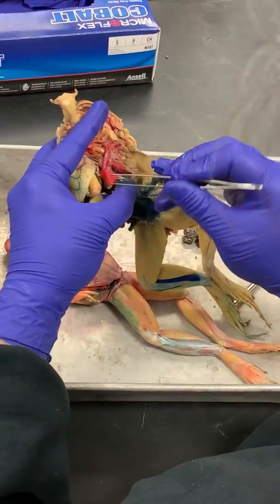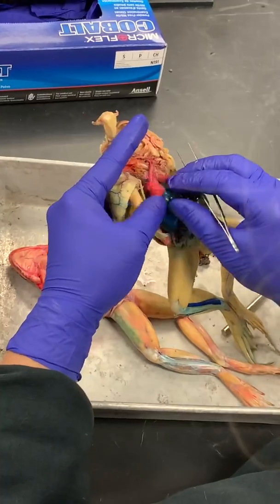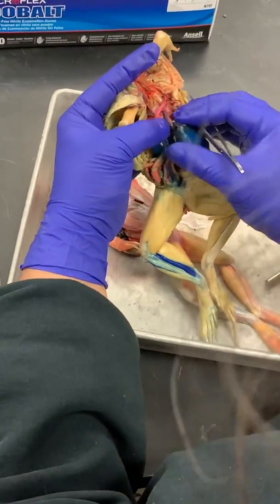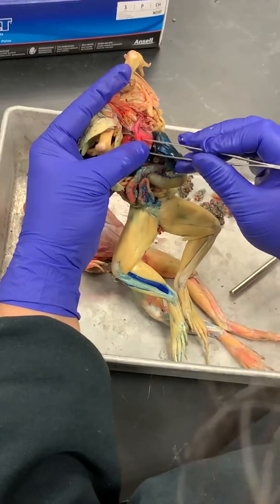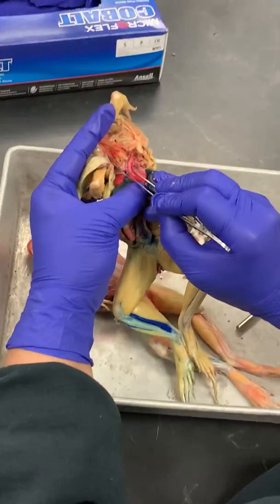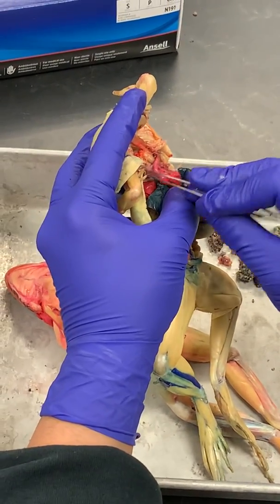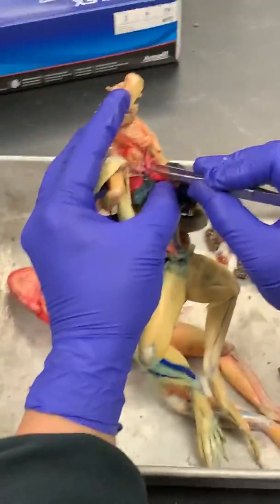So let's do this again. Here is, well, I'll do it on this heart. It's kind of hard to identify your right and left atria because look at how tiny. Here's the right atrium. Here's the left atrium, this gray part, and then the ventricles, this big thing here. And this, see where the vessels are together? This is your conus arteriosus, and then you have one right truncus arteriosus and a left truncus arteriosus.